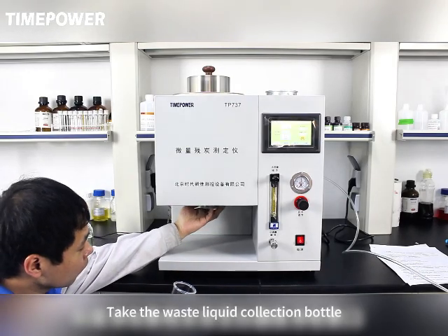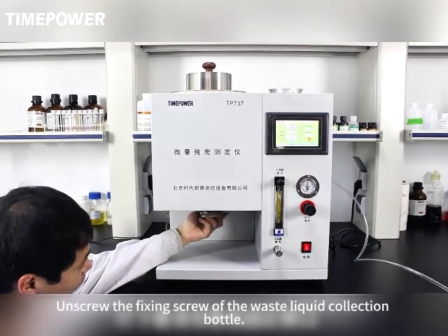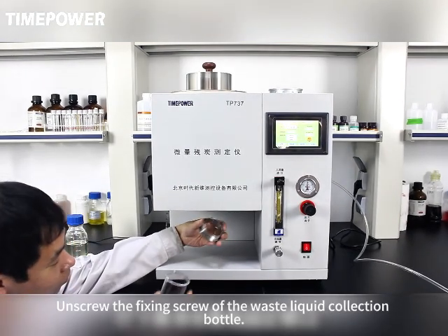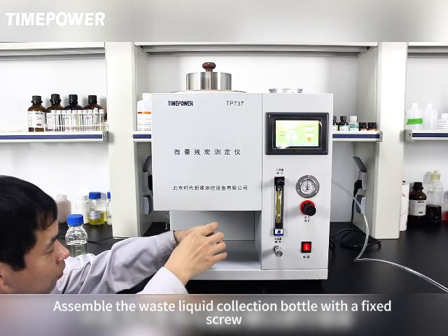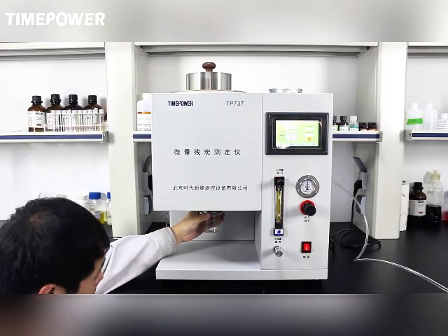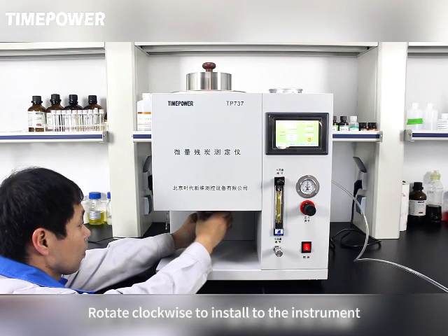Take the waste liquid collection bottle and install it to the instrument waste collection port. Unscrew the fixing screw of the waste liquid collection bottle. Assemble the waste liquid collection bottle with the fixing screw. After assembly is completed, rotate clockwise to install it to the instrument.